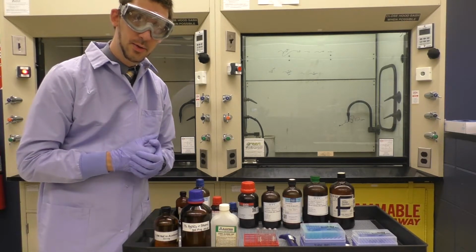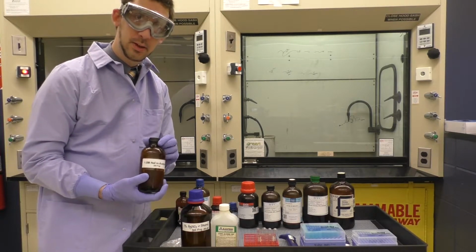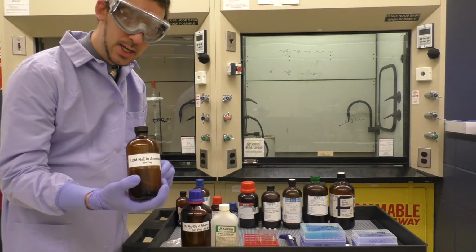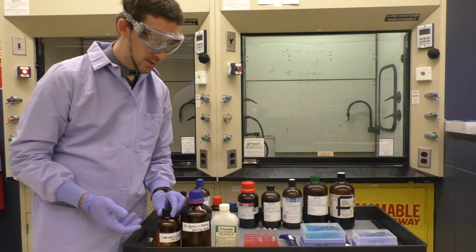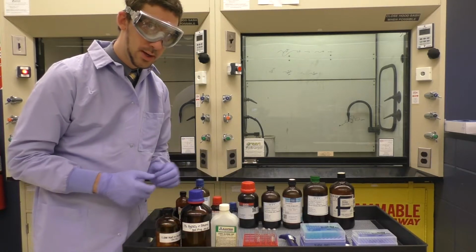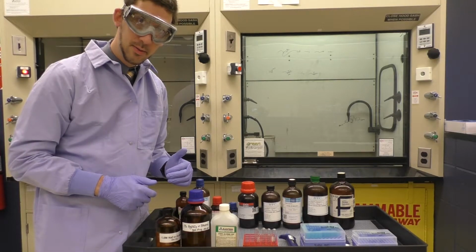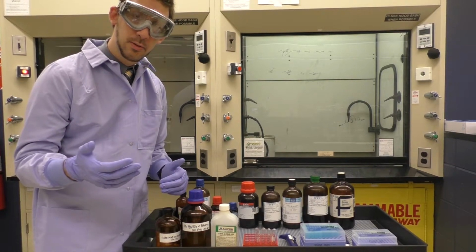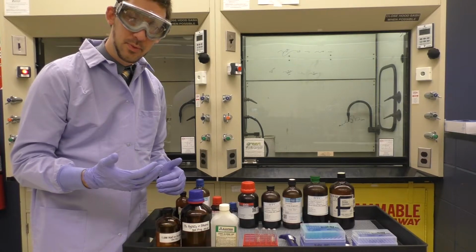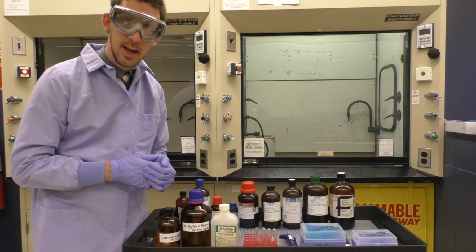Then we will clean out all of the test tubes carefully, and we will add 500 microliters of the 1 molar sodium iodide into a test tube. Add 100 microliters of a substrate and start the timer immediately upon addition. And then again, look for the formation of a precipitate. And we'll do that for all 10 substrates for the SN2 trial.